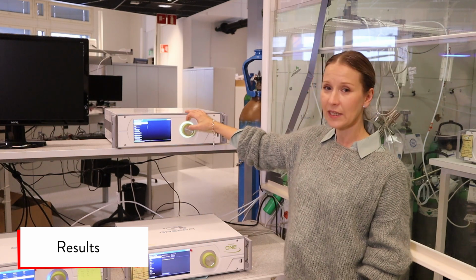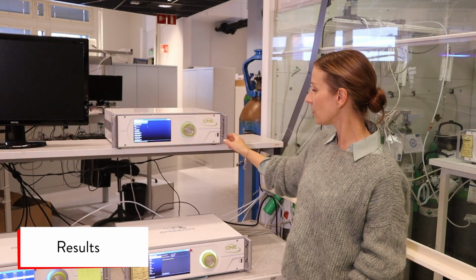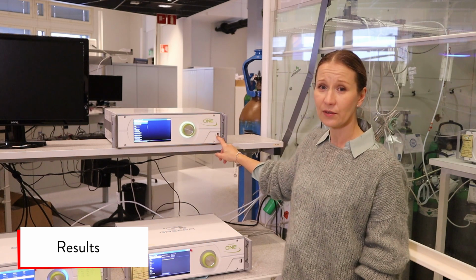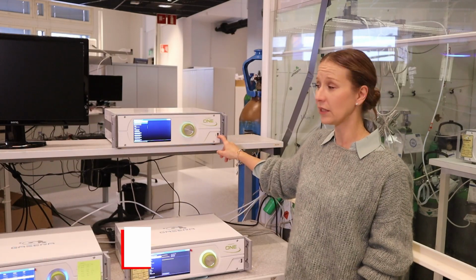If you want to save the measurement, you can select save to USB storage, which stores from the USB port, or you can use an external PC to conduct the measurements or exporting the data.